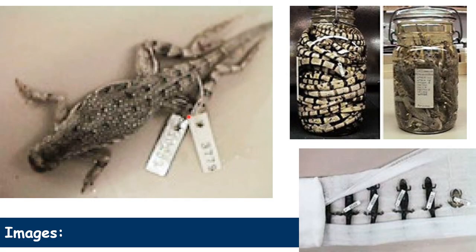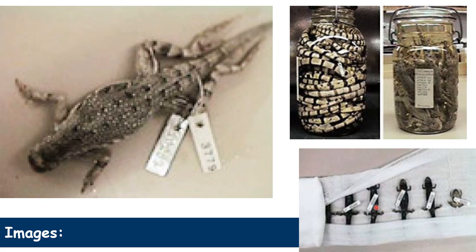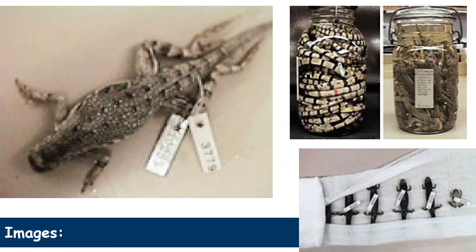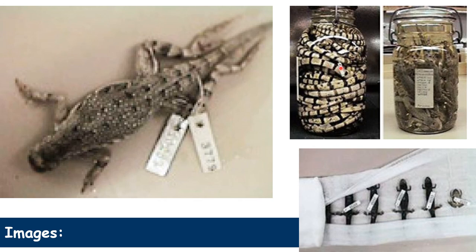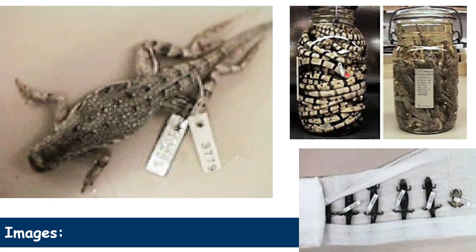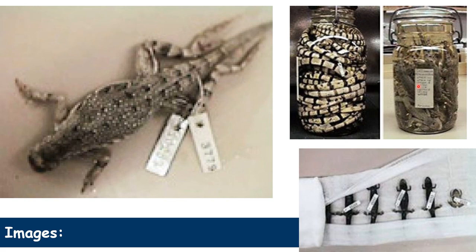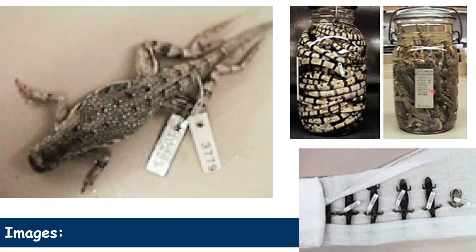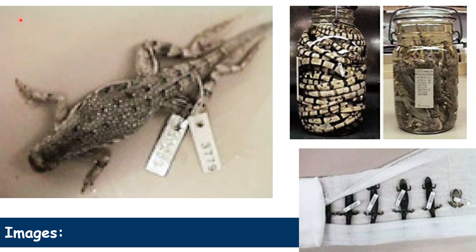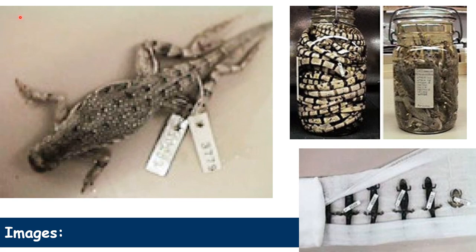Here are images showing labeled specimens. You can see numbers written on the labels. The animals are in an erect position in the jars. We can see a snake with a tag attached showing its name. There is also a jar where the animal is placed and the name of the particular animal is mentioned. I hope from this video you can understand a lot and gain useful information.